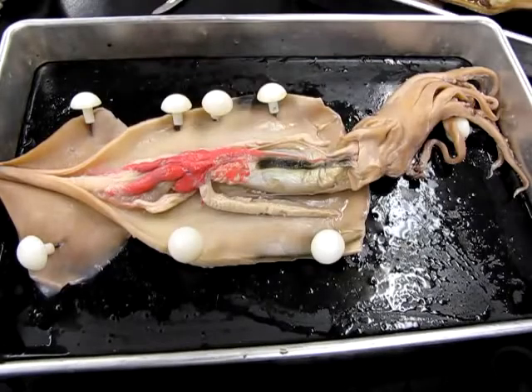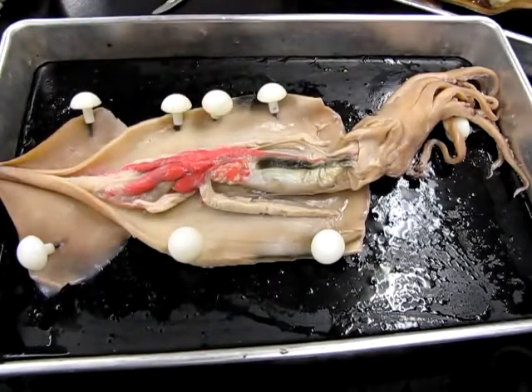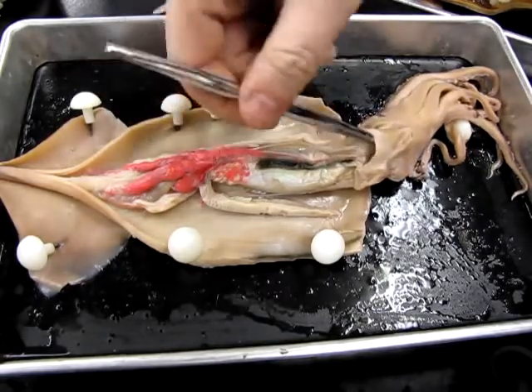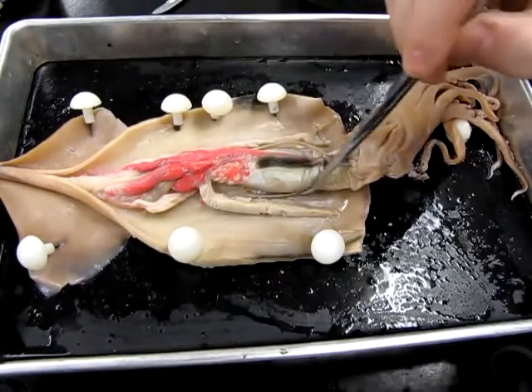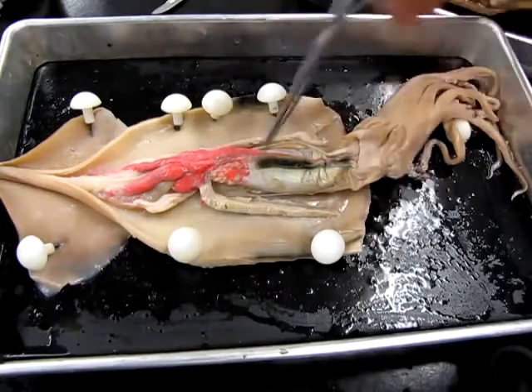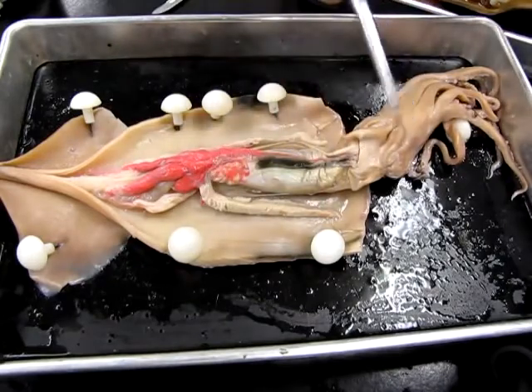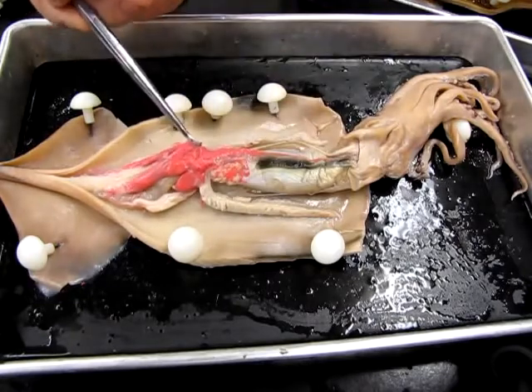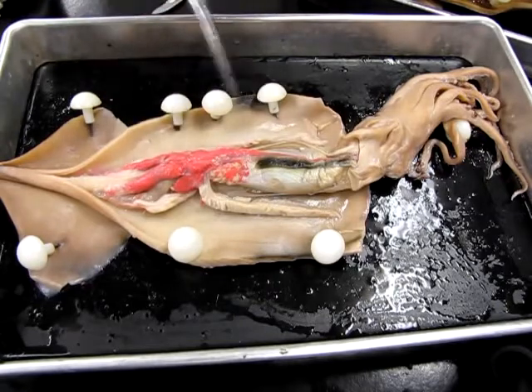This is a male specimen. You can see I've pinned down the mantle here to expose the mantle cavity. So this is the siphon down here, the funnel, just to orient yourself. So let's have a look and see what we can find here. The first most obvious structures might be these long, conspicuous, feathery organs running down either side. These are the gills, obviously, which are involved in gas exchange, and they attach up here at the same region as this pinkish structure. This is the multiple components of the heart and some of the main veins and arteries.